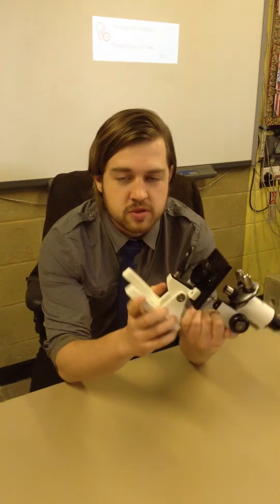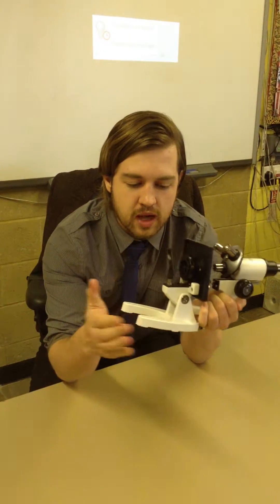Good morning, Year 7, and what we're going to be focusing on today is I'm going to be showing you how to use a microscope.